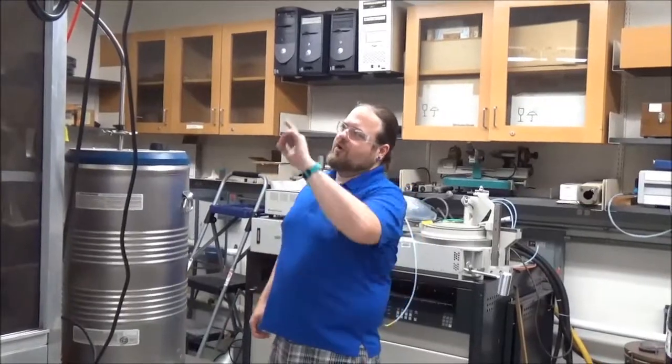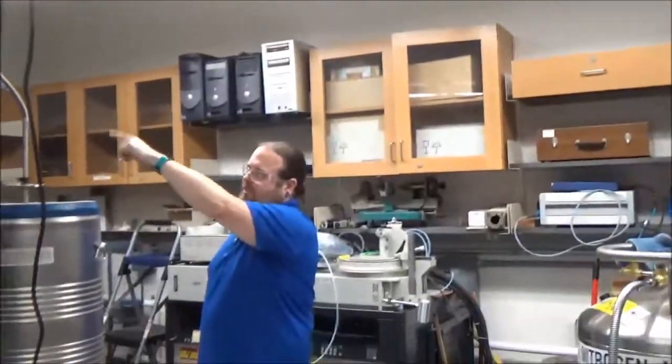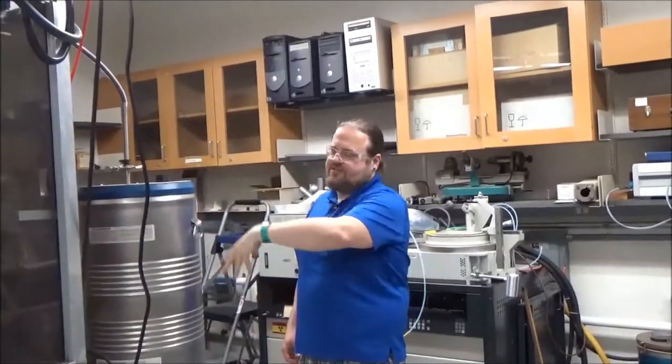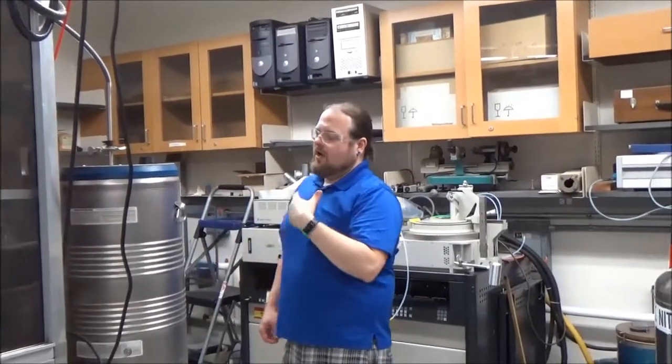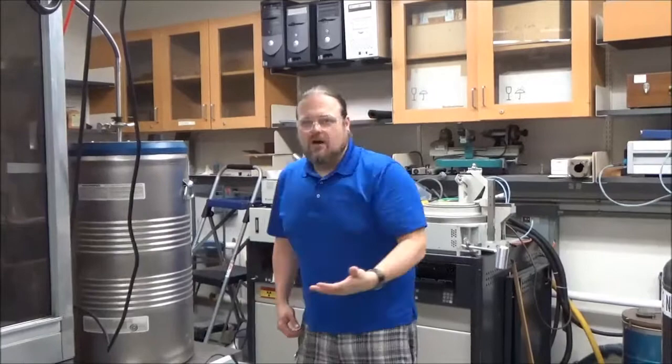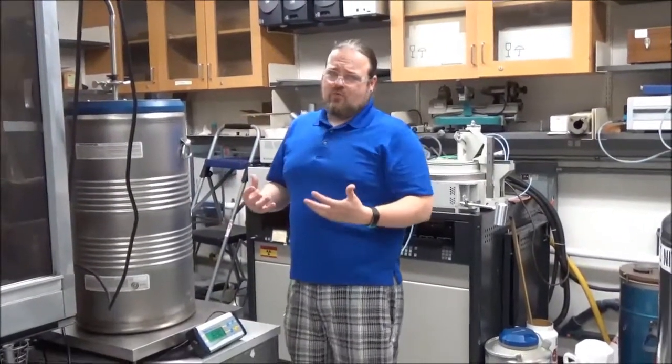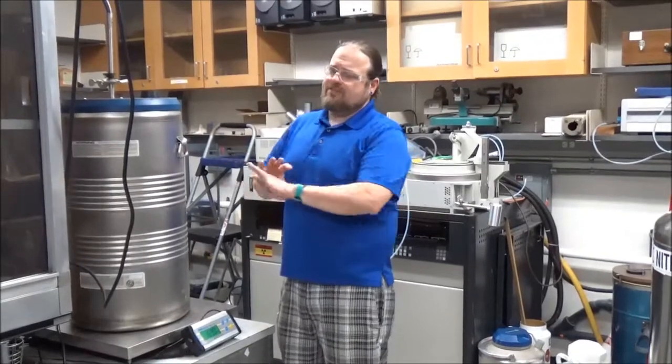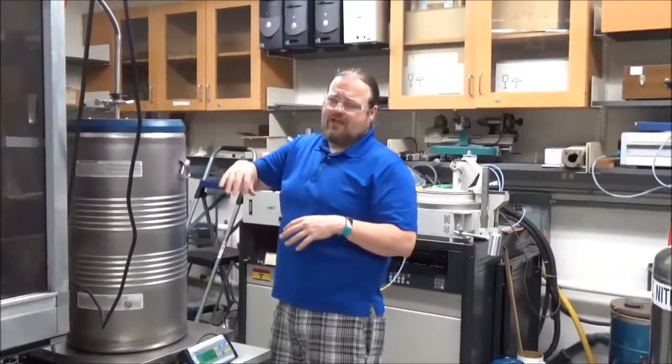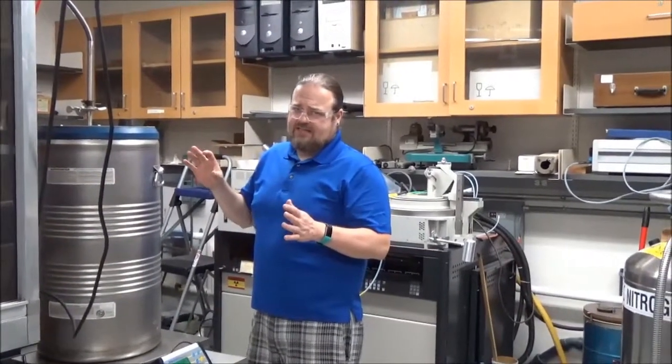Part of the process, what we also are going to do, we're going to apply the vacuum, but also the vacuum is going to pump down the transfer leg, and there's a desiccant inside here. We actually want to heat up the transfer leg and hold this whole system under vacuum for about 24 hours to really make sure everything is pumped out, and that actually we've evacuated all the moisture from the desiccant inside of this thing.